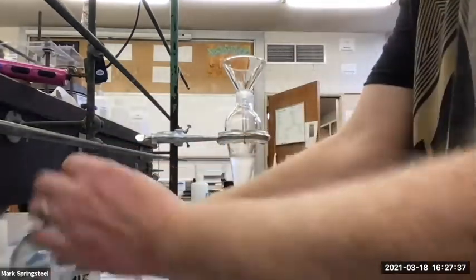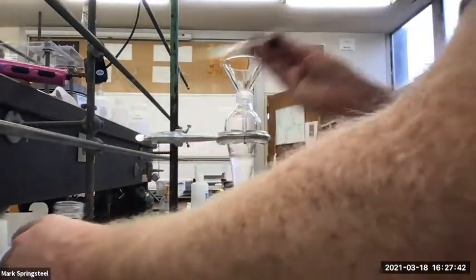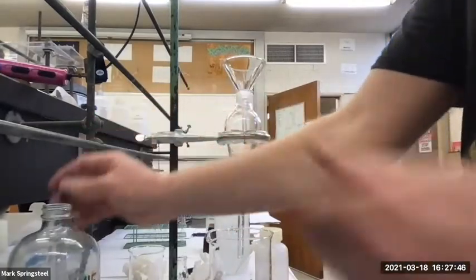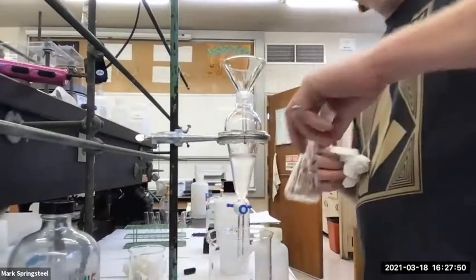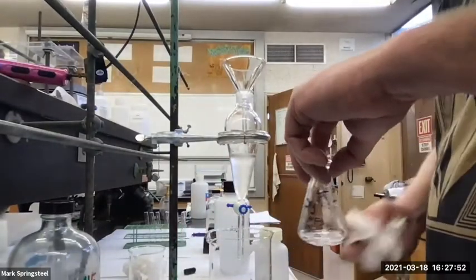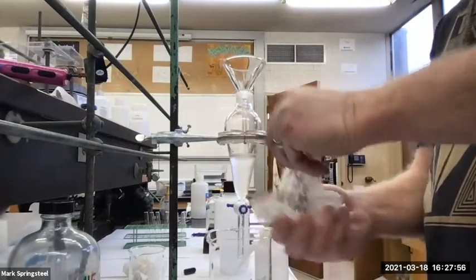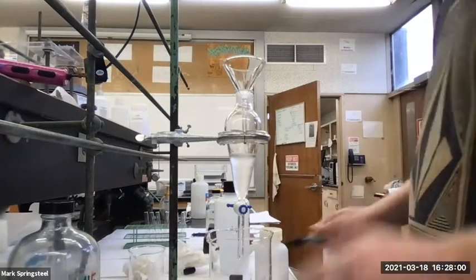Oh, okay. And then after I've added that in, oh, I'm making a mess. This is the problem with Sharpie in my organic solvents. We'll wash it away. That's okay. But it's so convenient to write on it quickly. Here, I'll show you the proper way.